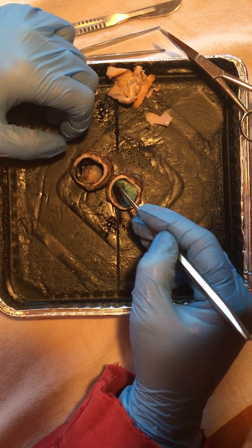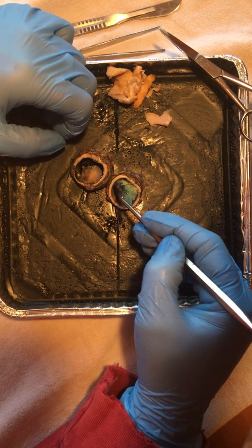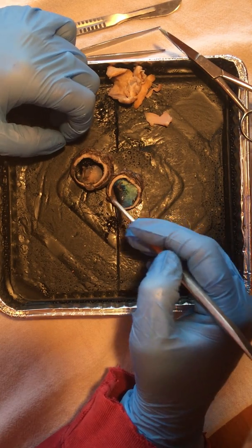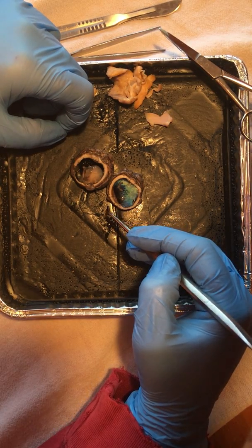It's a little bit torn apart here, but you can see some of the retina that's remaining. The retina has a consistency almost like wet tissue paper, so once it's all clumped up, it's really difficult to get spread back out. But that retina, that's that light sensitive portion of the eye.